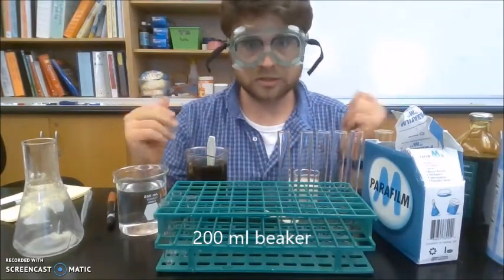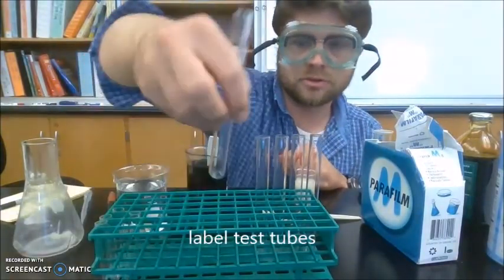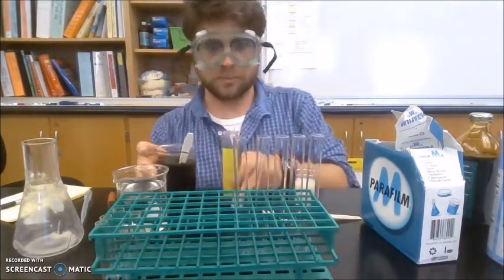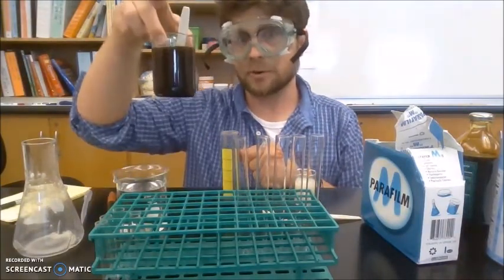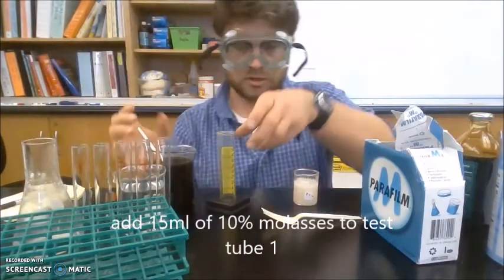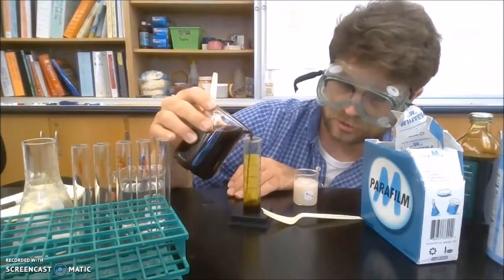Okay, so let's start. So first, I labeled my test tubes 1, 2, 3, 4, 5. So I'll start with 1. And so I want to put 15 milliliters of my 10% stock solution. So let's move this over here. So I have my molasses. So let's pour 15 milliliters in.